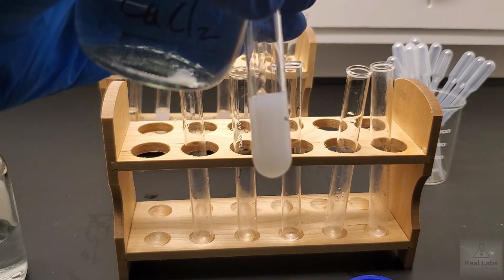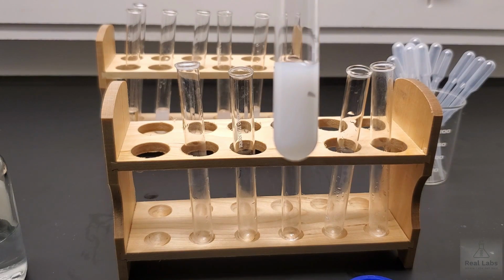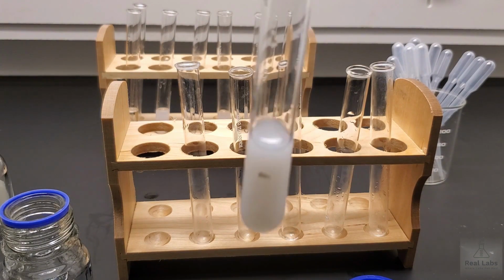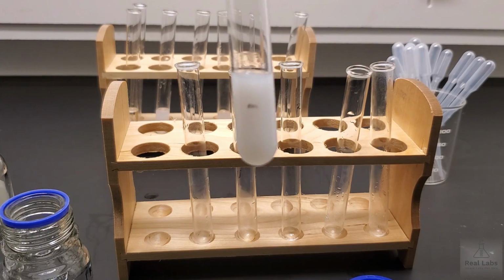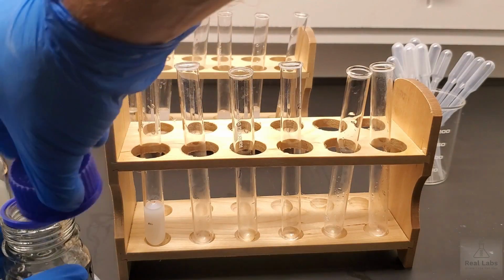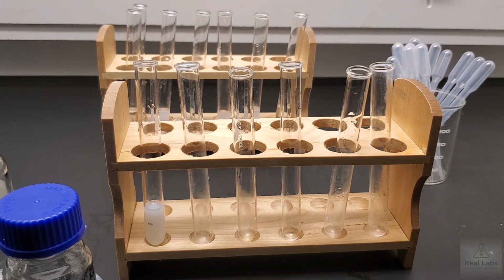And then we'll add this while it's in shot for you. You can see that as I add that, you start to see a product formed. It's hard to see exactly, but what you're really seeing here is another one of those reactions where you probably have a solid formed in a liquid system. We're going to put these two away, and then we're going to run our next pair of reactants.